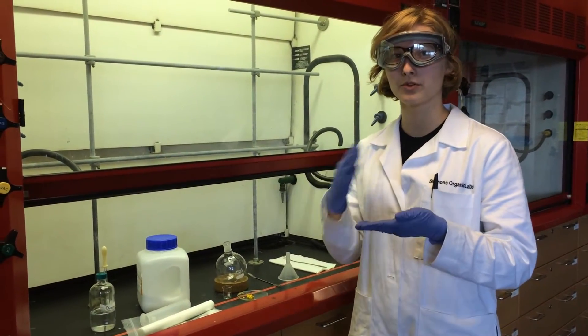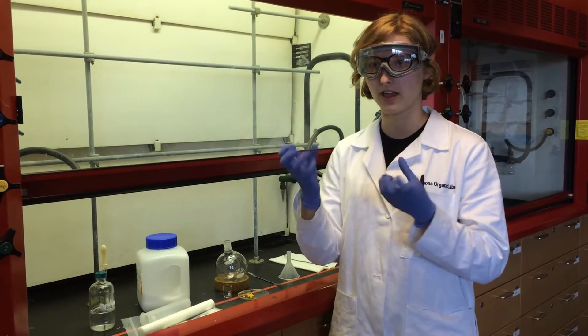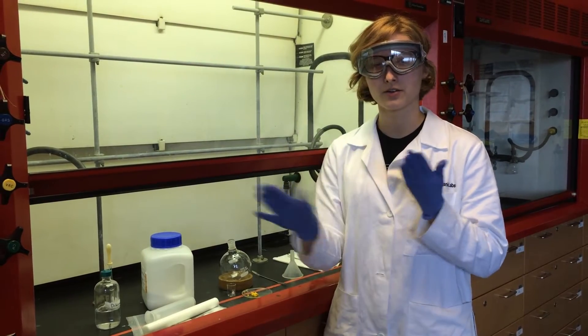If you have a solid dry sample that comes off very easily and forms a powder, it's all set, all prepped.